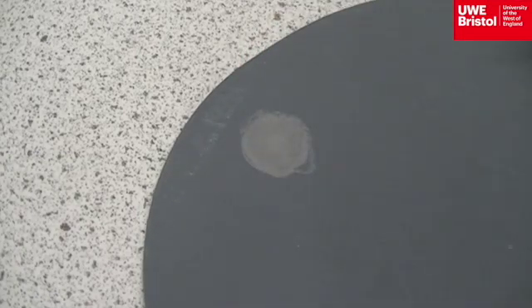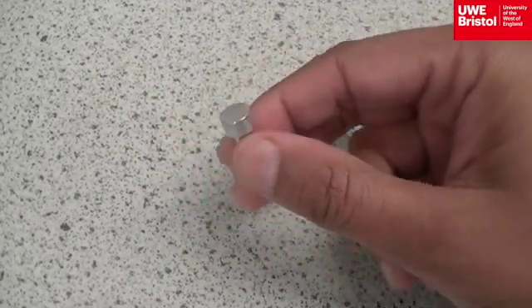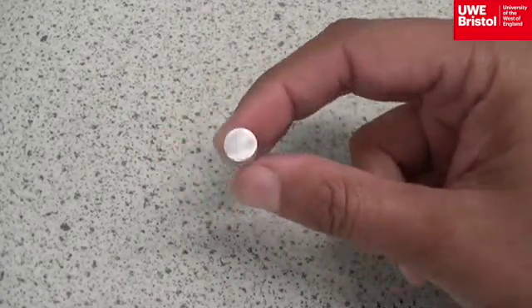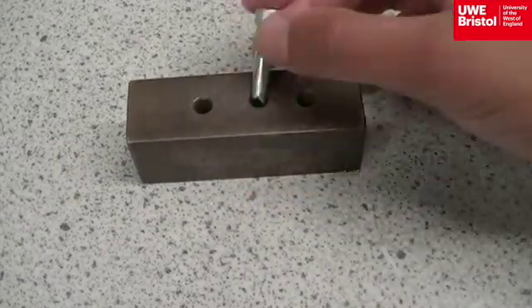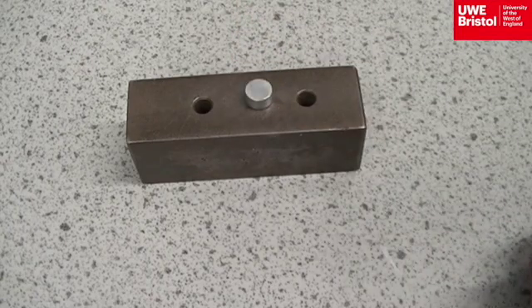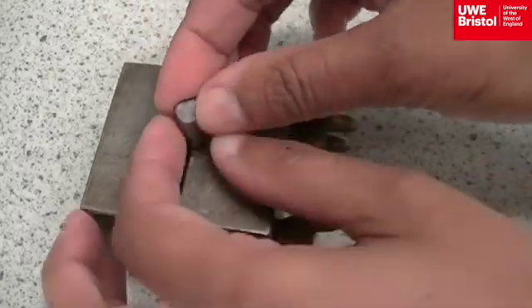It must also be held firmly in position for testing, so as not to move during the load application. For the broken test specimens, this can be a block with holes in it to hold the specimen. And for impact specimens, a clamp can be used where the ring nuts are tightened securely.